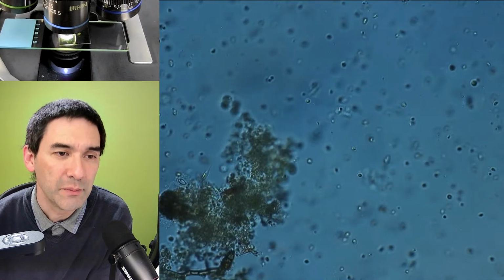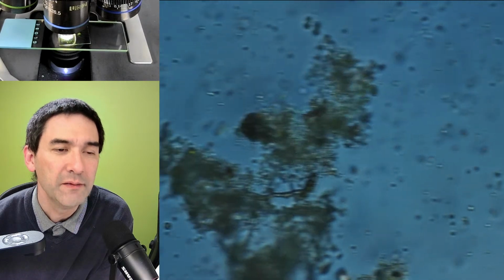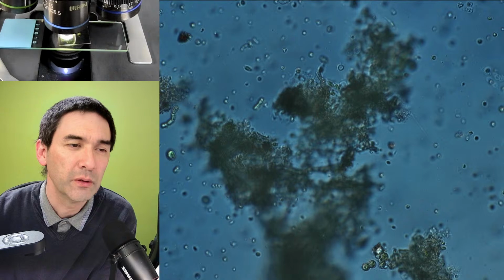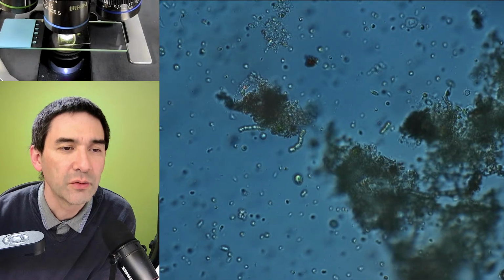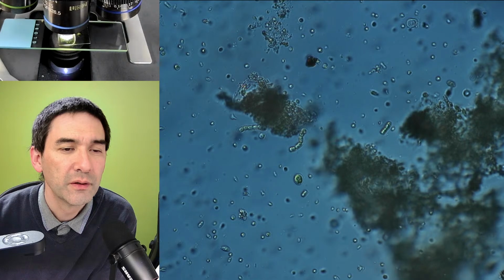What surprised me a little bit is that most of the bottle was covered by leaves and the water was not visible, right? So only very little light seemed to have been able to enter the bottle. But at this magnification already, we can see that there are indeed a couple of different cells around here. Some of them are now moving.